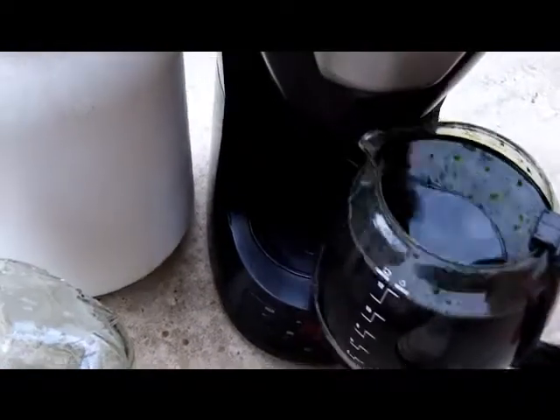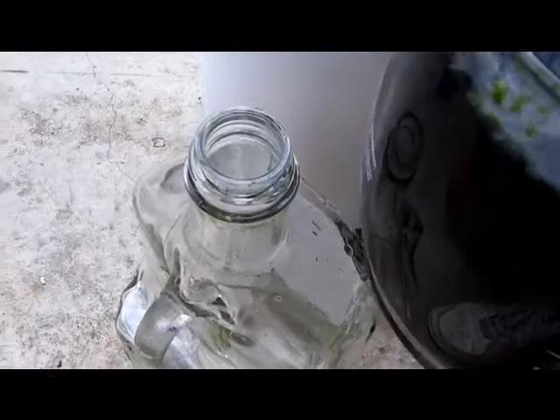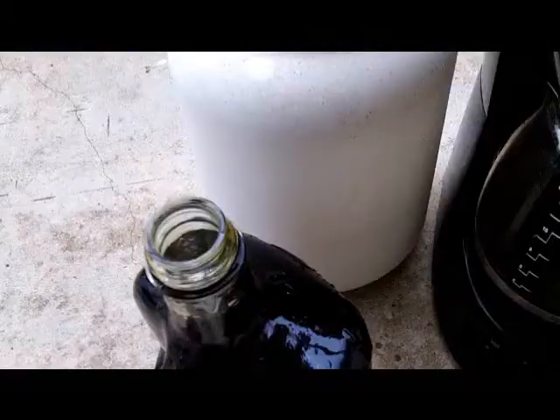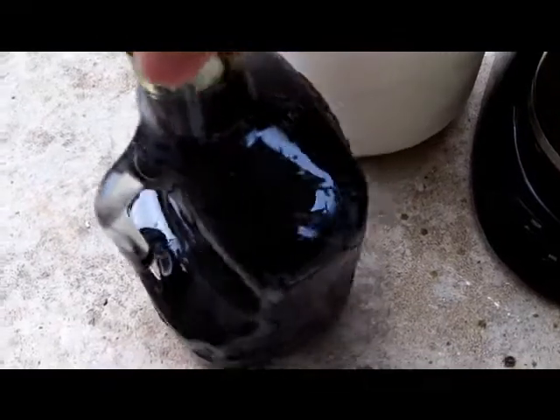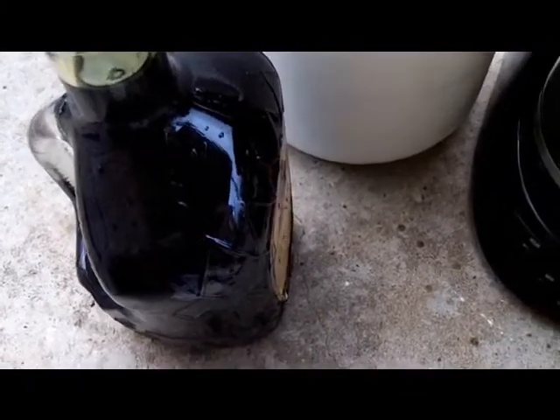It's real handy to have a coffee pot — it goes right down in there. All fluids need to be saved. This is toxic — mostly copper chloride — and not disposal friendly. There could be small amounts of dissolved gold in here, so we'll save this. We can use electrolysis to recover the copper and nickel, and we can also have it tested to make sure there's not platinum or anything else in there.